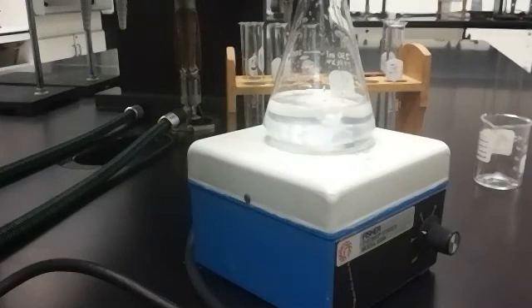I'm only going to do a couple more on the film, and then we'll jump into what to do with the data. Sometimes this color change is like a dark blue or a black, and sometimes it's more of a yellow color. It really depends on the nature of your starch, whether or not your starch started to degrade some. In this case, today we've been getting more of a yellow color, but that's okay. It still works very well as a clock reaction.